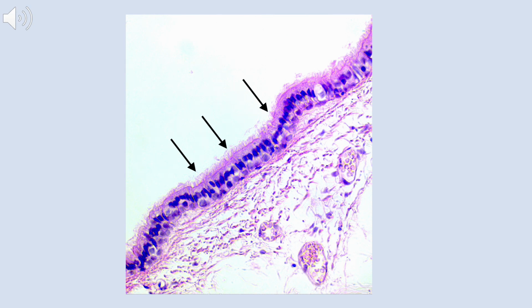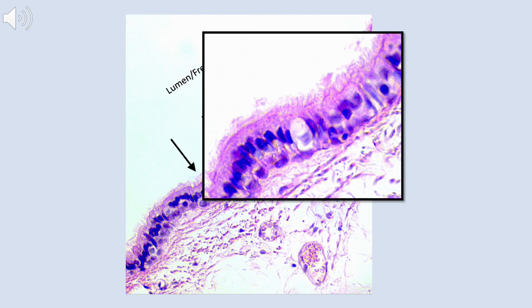All right, hopefully the free surface was clear to you. Our arrows are in that free surface indicating the apical side of an epithelial layer. Now I need to figure out which kind of epithelium it is, and there's a few key identifiers in here. One, the cilia. Those little hair-like extensions, they're there to help move mucus across the surface. That really indicates that we're in the respiratory tract, most likely. So that puts me right off the bat thinking that's a pseudostratified columnar epithelium.